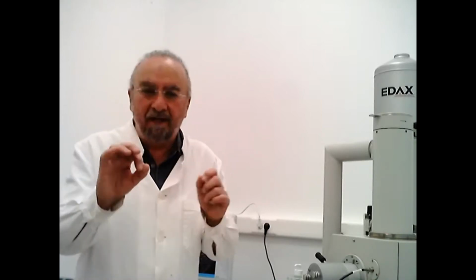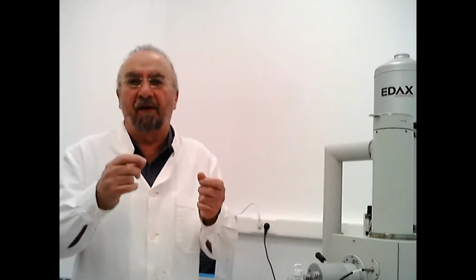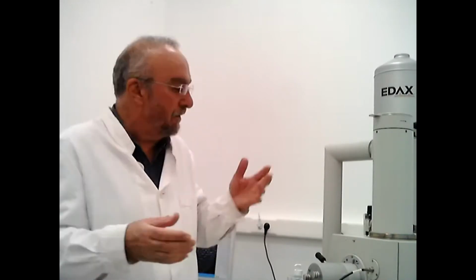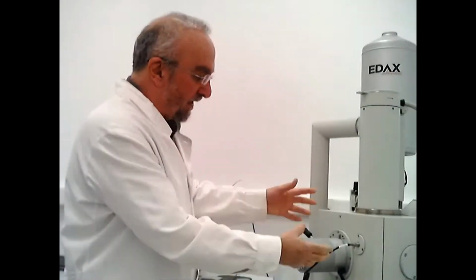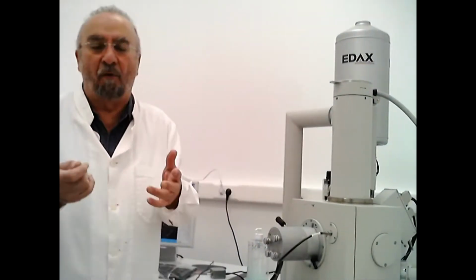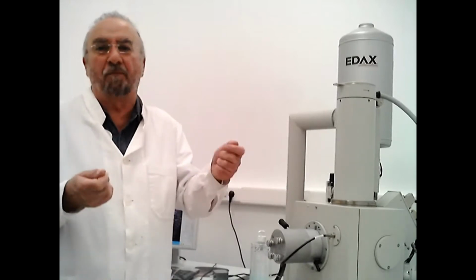A forensic scientist will go around the place where the crime took place, and they start collecting tiny evidence like hairs, tiny pieces of blood, for example, pieces of soil or material from the ground, whatever they can find. And then one of the first things they do is bring it to the electron microscope, which is this. This is a chamber which has been evacuated because electrons are so small and so sensitive that they must be protected from hitting the atoms and the molecules in the air.